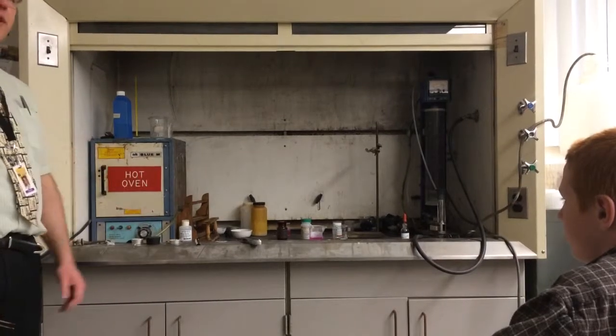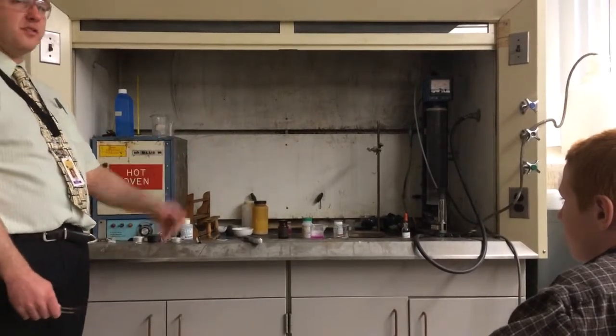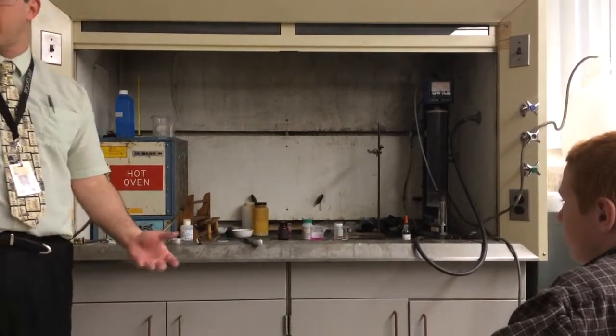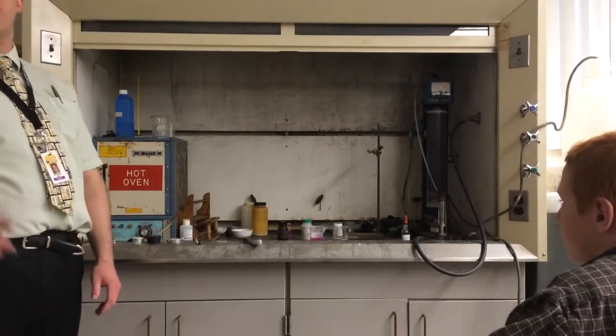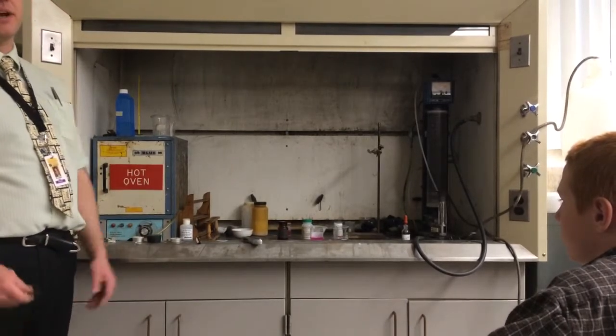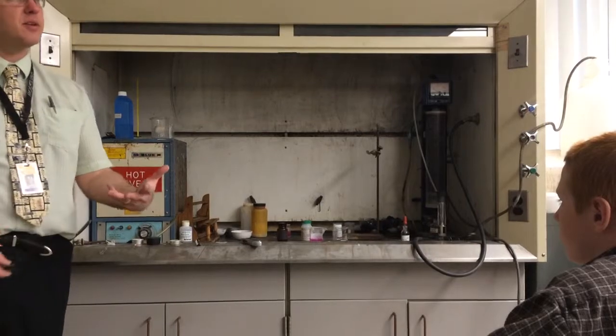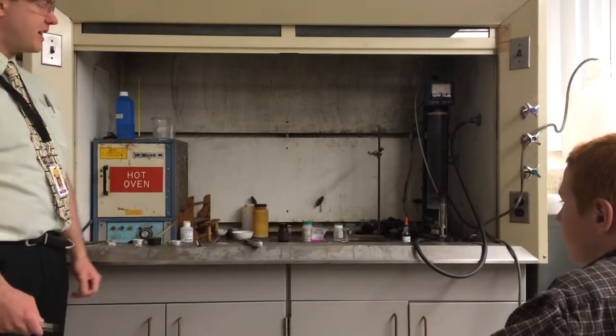This is actually lighting on fire. What do you think the gas is that is being produced that would be catching on fire? Oxygen. Oxygen would support combustion, but it itself is not flammable. Hydrogen. Hydrogen gas is being produced.